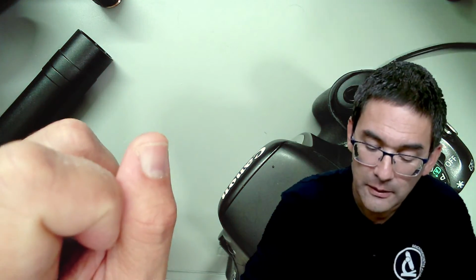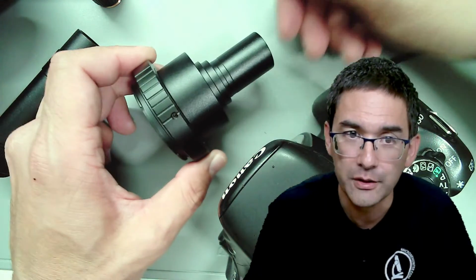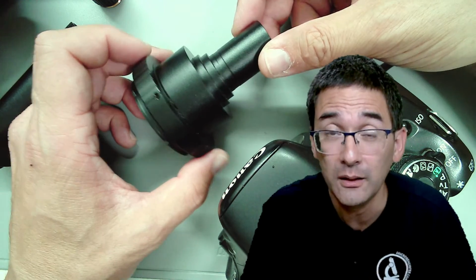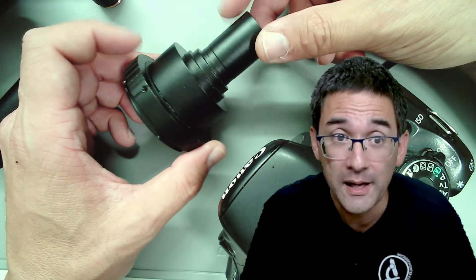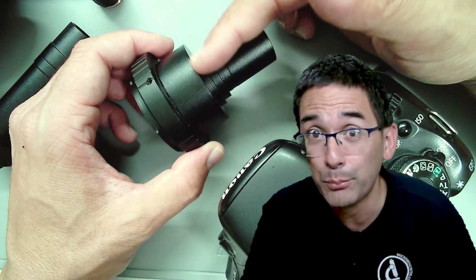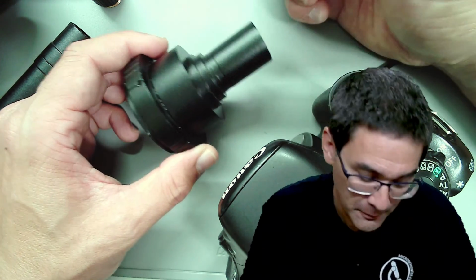There is now another adapter that I have over here. They sell it on Amazon as well. I think Amscope has one. I got this specific one from AliExpress, directly imported from China, which was significantly cheaper.